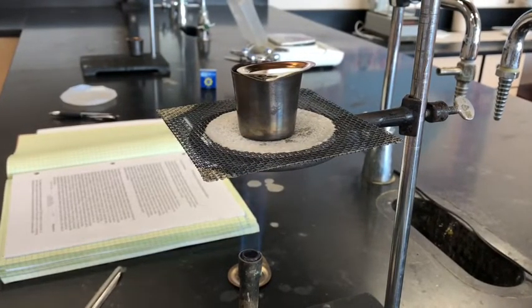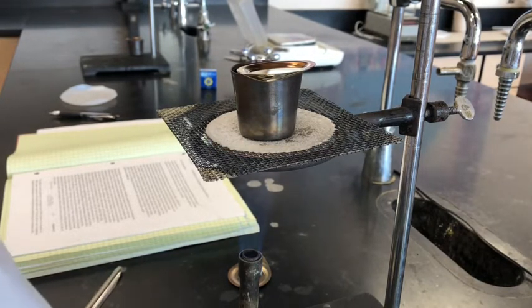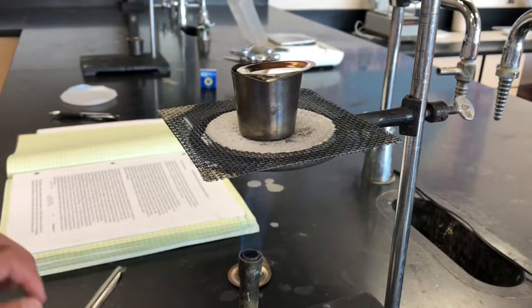So we placed the sodium bicarbonate, roughly the 2 grams that we measured precisely over there with the analytical scales to get 4 significant figures. Now we put it in the crucible that was already pre-weighed, and we're going to heat it up for about 2 minutes. And this is so that the sodium bicarbonate decomposes into sodium carbonate, water vapor, and carbon dioxide.